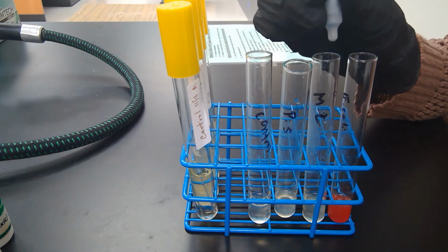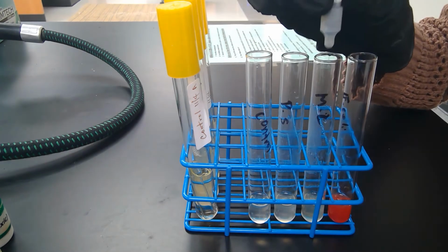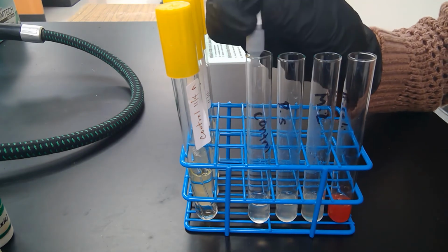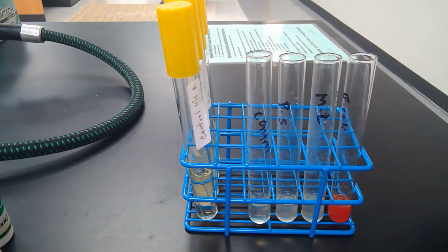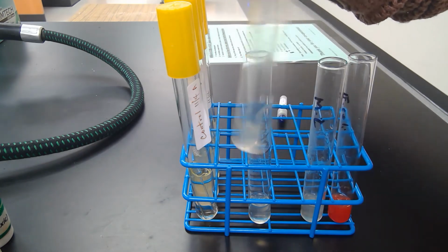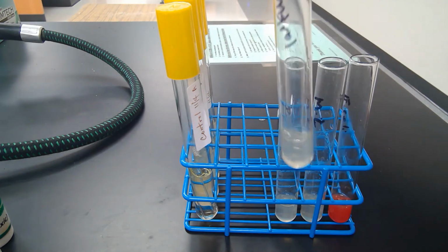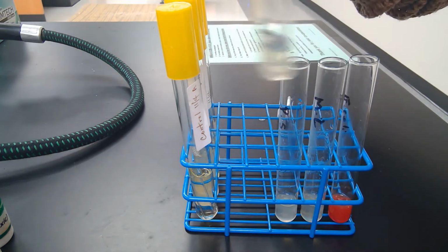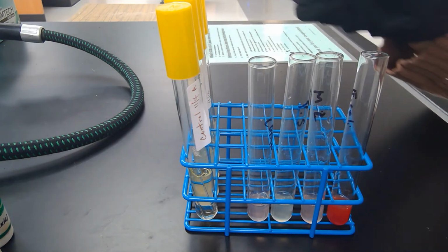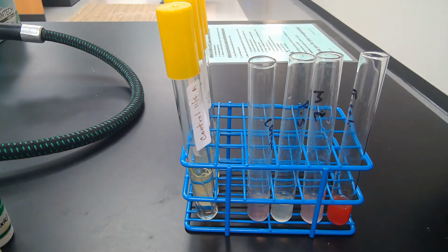We're going to add zinc to the ones that we don't know if they're positive. I don't know if you can see it, but it's just a little powder that's released from here. You don't need very much. And then you go ahead and mix the tubes. Okay, and what you'll notice now is that the Micrococcus luteus and the control are turning pink.